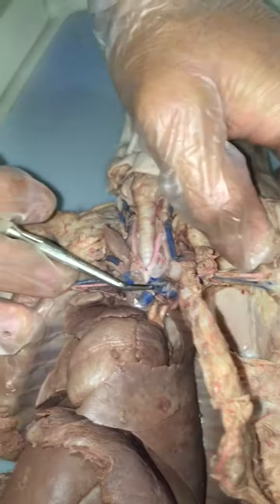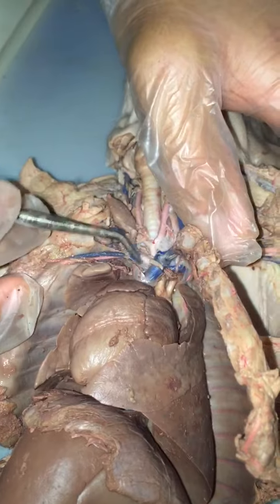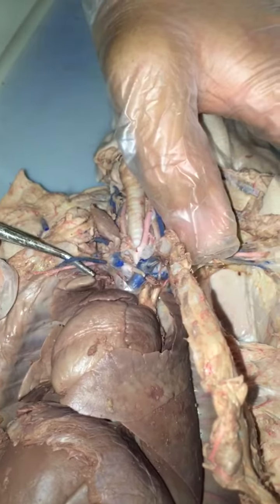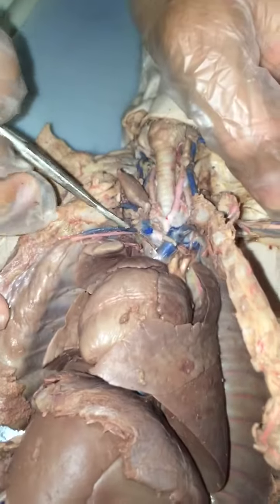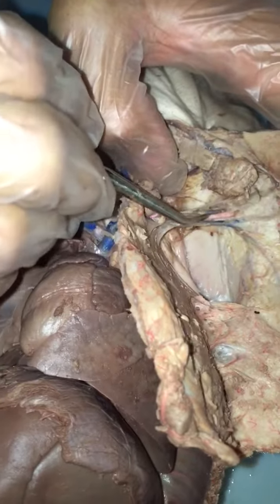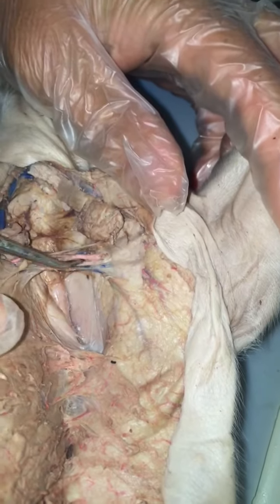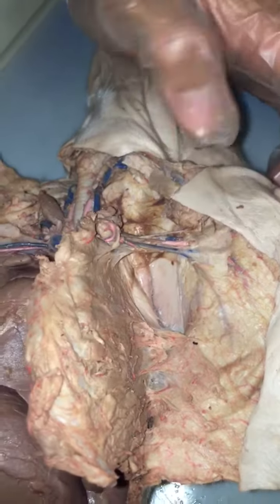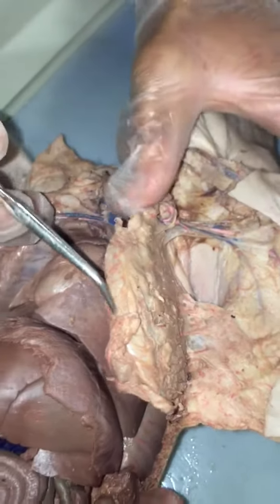Is there anything else? Subclavian vein. It just follows with the subclavian arteries. Are there right and left? Yeah, there's right and then left, but we're probably just gonna pick one because the book just shows subclavian vein. Well, how about left subclavian vein? It's one of these, but we don't know which one. They haven't separated it. I think it's this one. It's the left subclavian, because you have left subclavian artery right here, and right next to it is left subclavian vein. Oh, which I broke. How about the one below it? Oh, I don't know what that one is. We don't have to know it though.